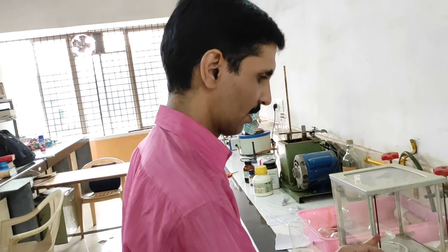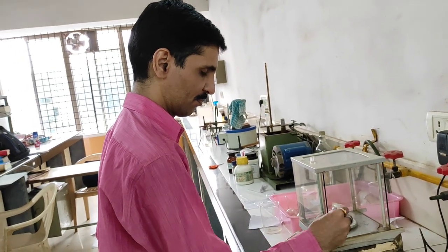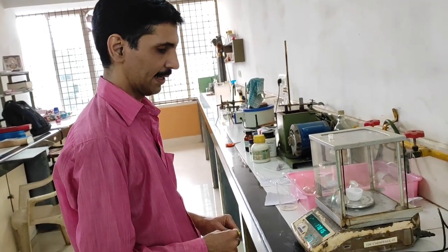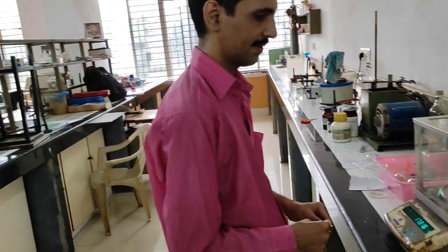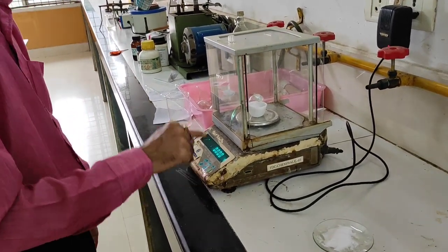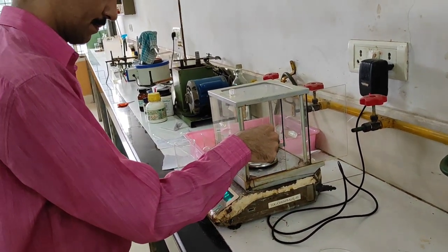We start now with the process. First step is the weight of the crucible, because we need a previously weighed crucible. You can see the weight of the empty crucible is 17.817 grams. Now we press the tare button so it shows 0.00, and then very slowly I am going to add one gram of the mixture.